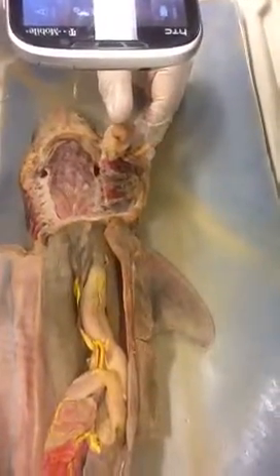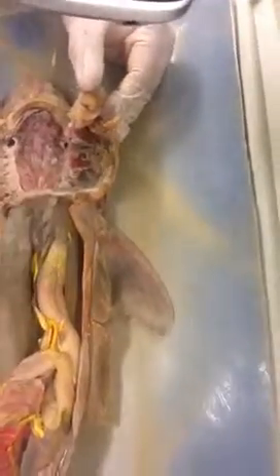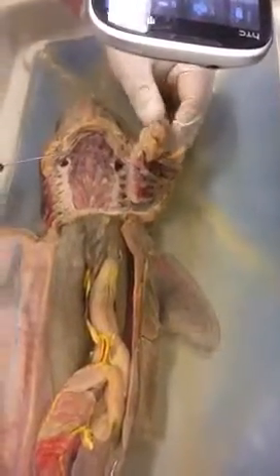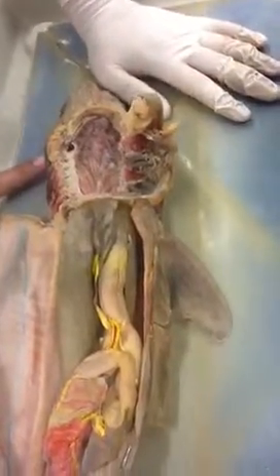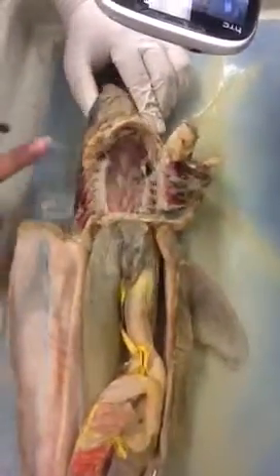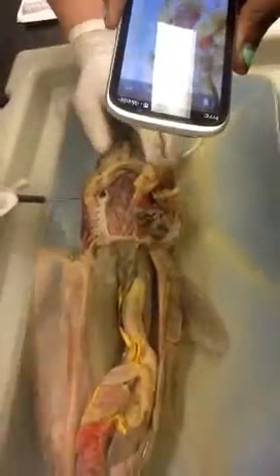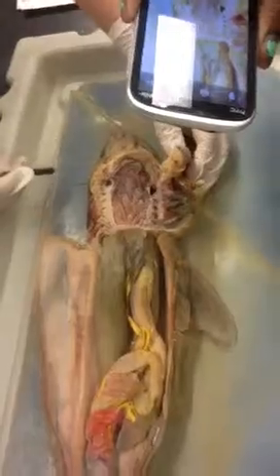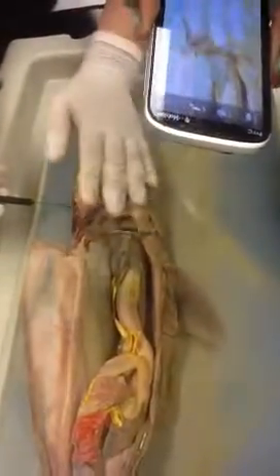Is that the spiracle? Did the spiracle have something coming out of it? Right here. Like veins or something? Yeah, there's an afferent and efferent artery. But you can't see them, right? Yeah, because your spiracle's up here. So I guess if you pull this all back, you could see it. But I think really, it connects somewhere over there. So on the model, you can say either internal carotid or efferent artery, depending on what he's pointing to. It's more or less the same thing.